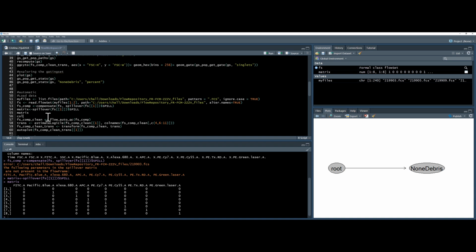So I will use the column names R command in matrix. What this is going to do is overwrite the column names in matrix with something of my choice. So I will use the C command again and paste in my values. But I obviously don't want the forward and side scatter, since they don't exist in my compensation matrix. And sadly, these all need to be bracketed, so it's going to take me a few seconds.